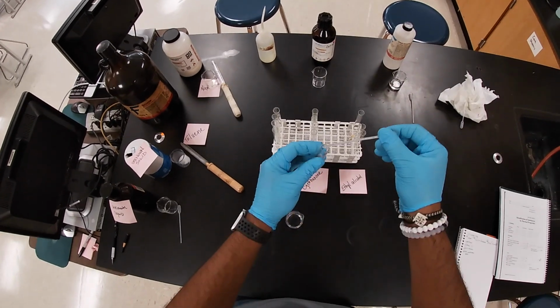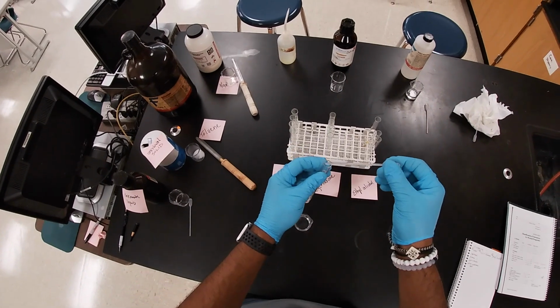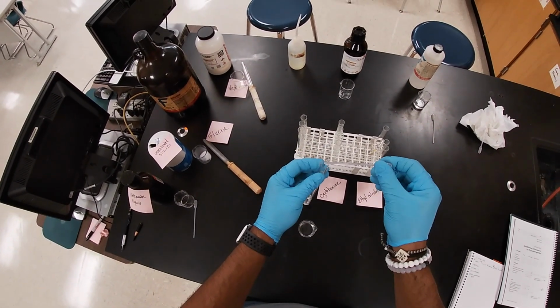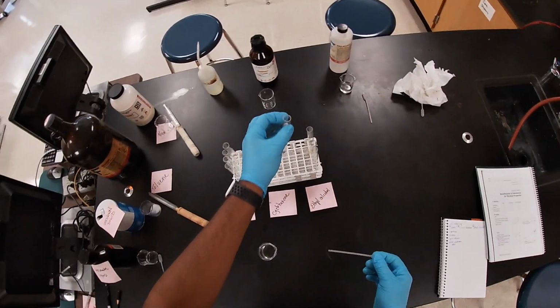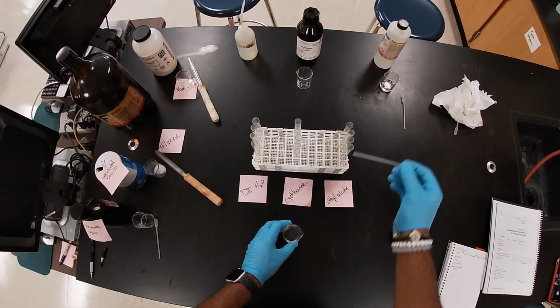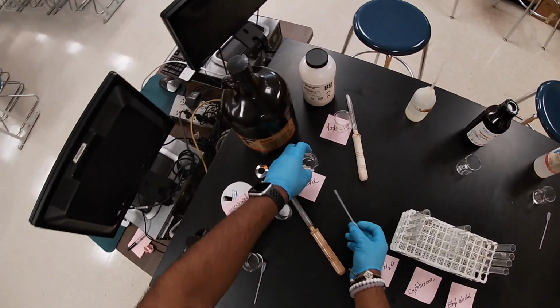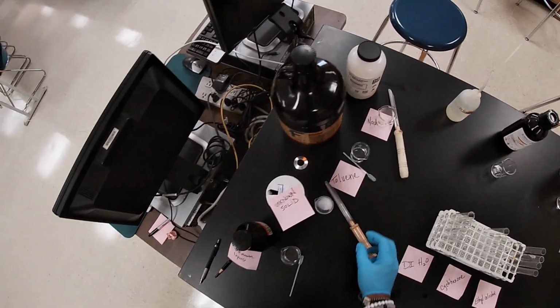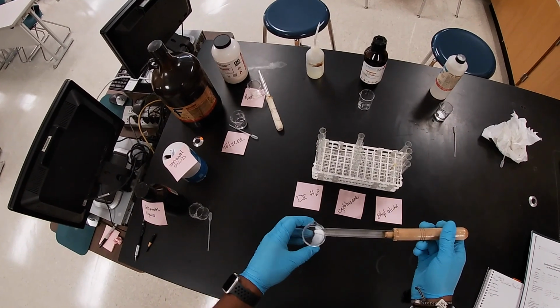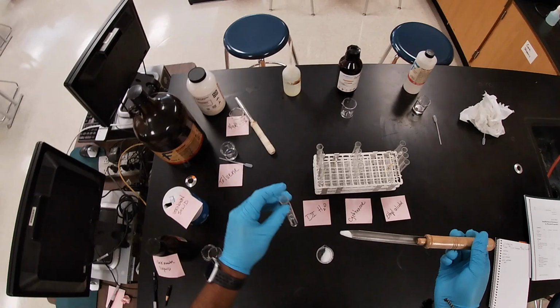Now my solvent is ethyl alcohol. I'm gonna put in some toluene, I'm sorry, as a solute. All right, that should be enough. All right. And so that's that one. And now my third. Now I'm gonna add my solid unknown into water.